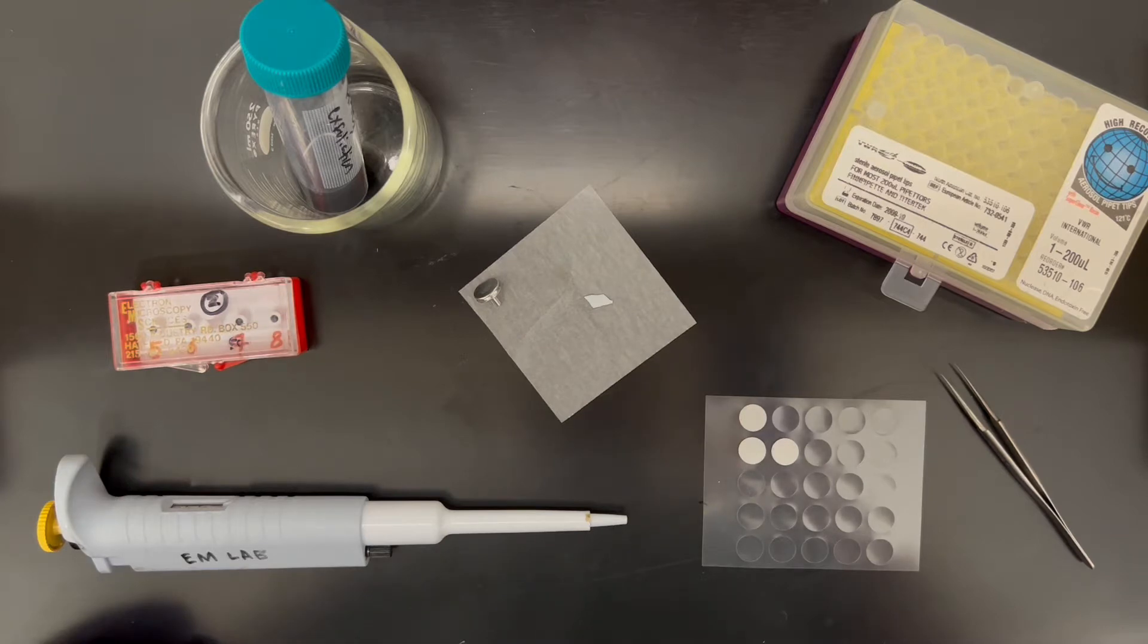In this video I'll be going over how to prepare a sample that is in a liquid suspension for SEM analysis.